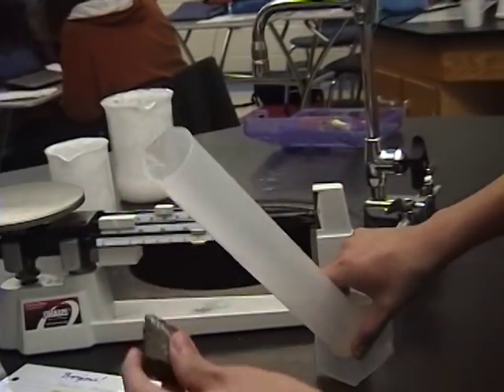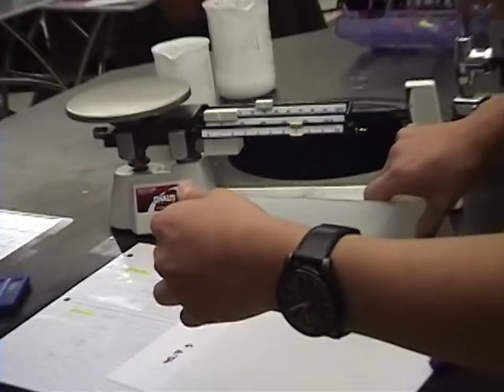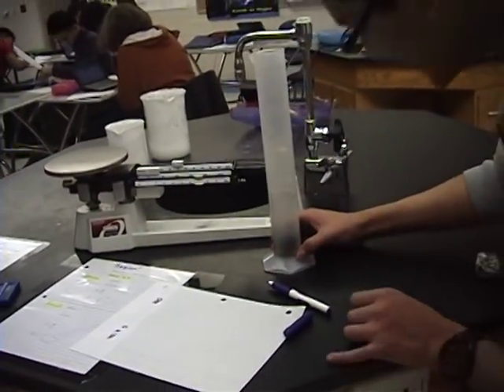That's the starting measurement. And then we put the rock in there. So it's, tilt it a little. Slide it in. There we go. It's in.